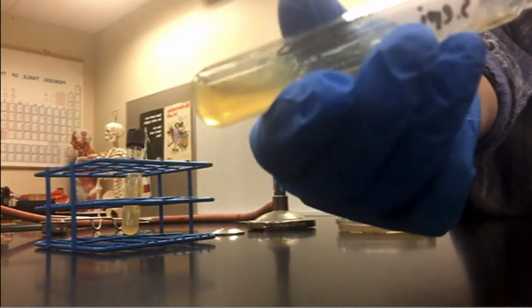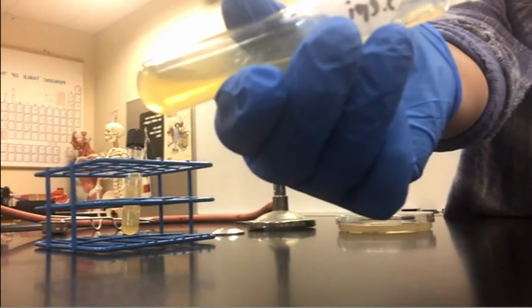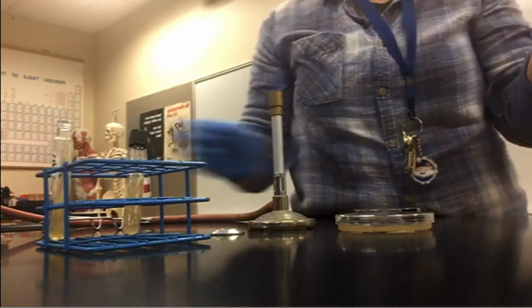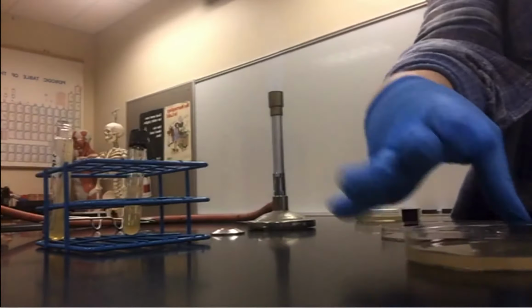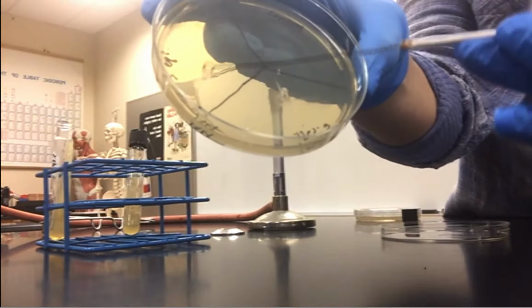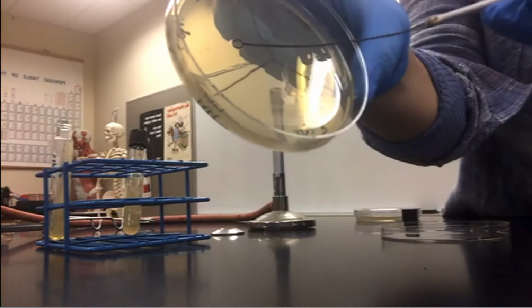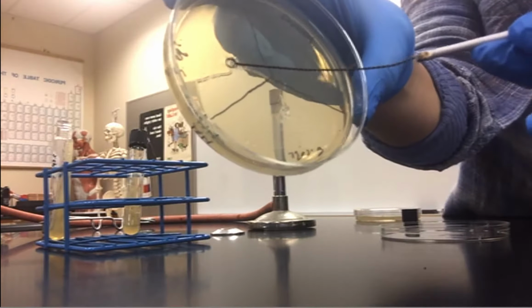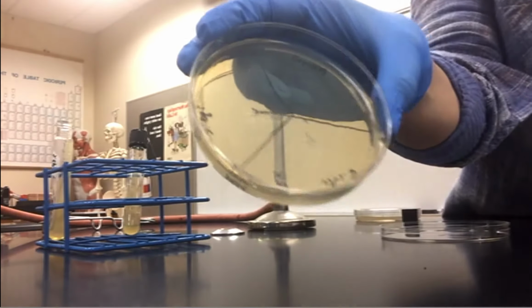Same thing, sizzle, scrape on the surface, get that bacteria. So I can put it down, nutrient agar plate, epi section, zig and a zag, and then maybe a little zig again, and then right under the surface. Come on, baby. Right in there.